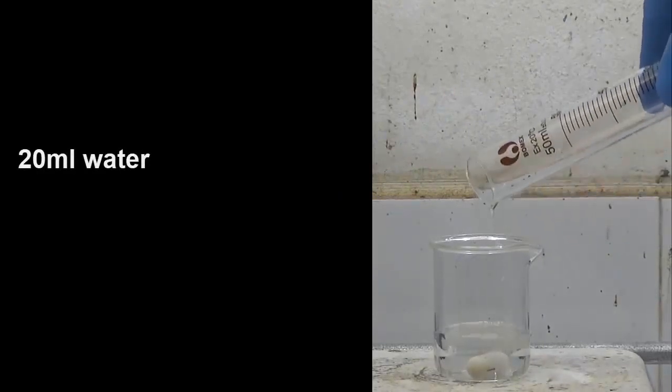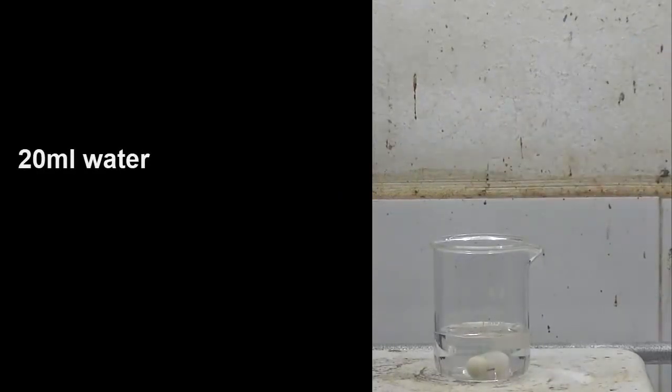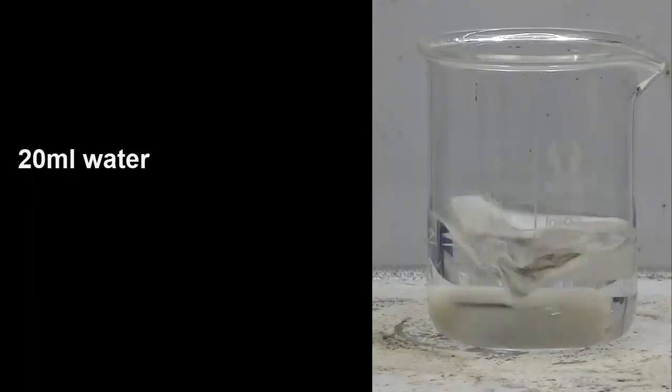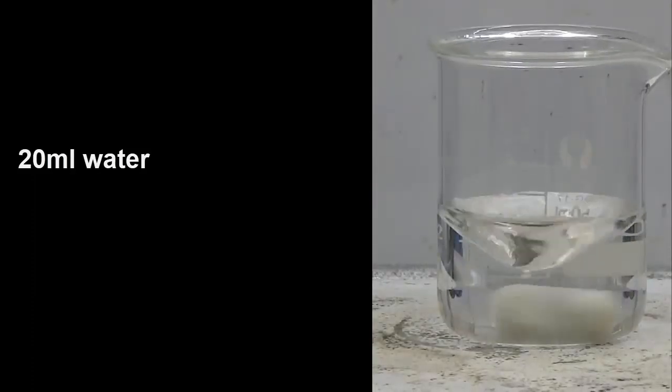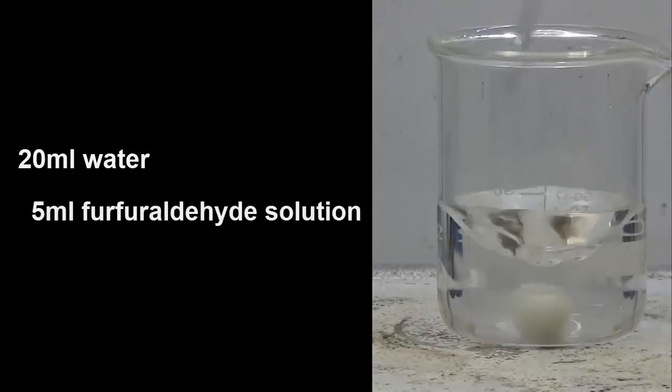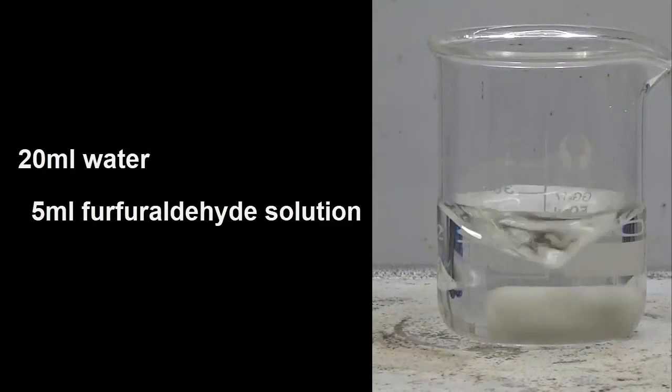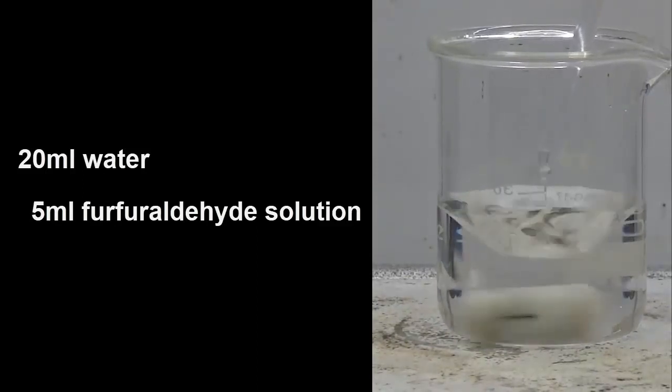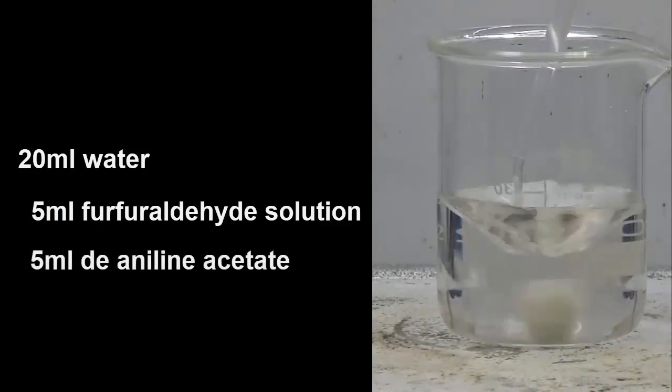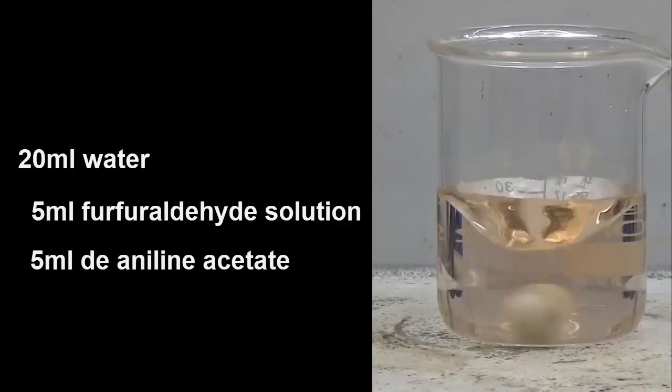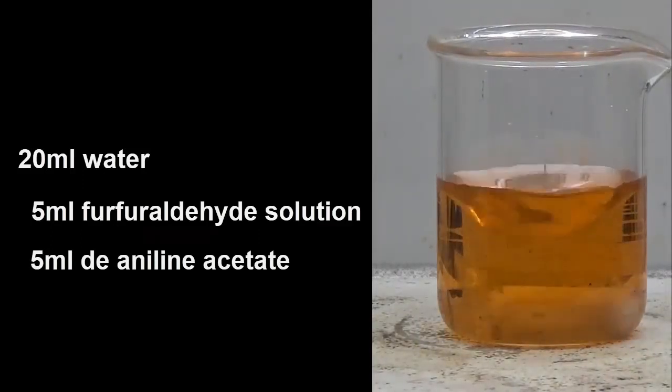Add to 20 ml of water and with stirring 5 ml of furfuraldehyde solution and 5 ml of aniline acetate. In case the test is positive, the solution is red.